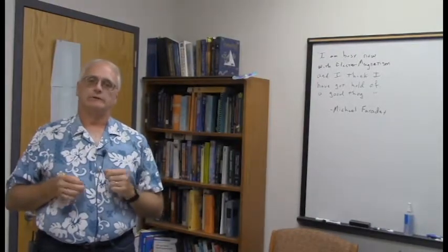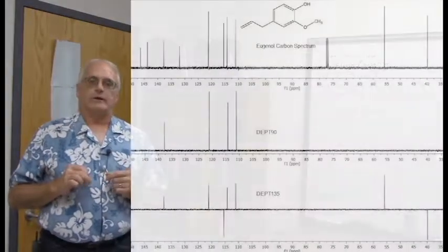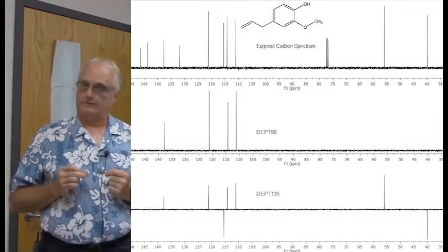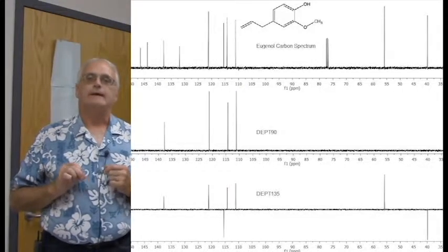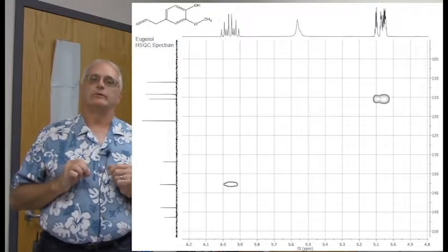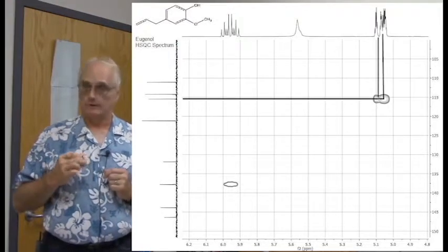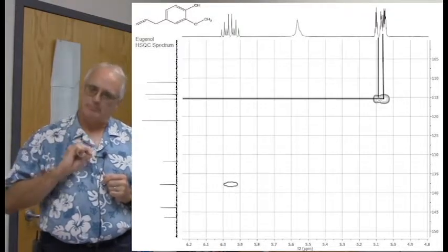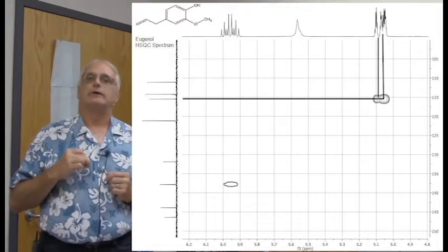And now we use our usual DEPT and HSQC spectra to really start trying to untangle this one. The DEPT spectra show everything we would expect to see, again focusing on the alkene region. There's our dear friend right at 115, the terminal alkene once again, shows up very nicely here in the DEPT spectra. And now the HSQC spectrum shows all the lovely correlations, and focusing on just the alkene region for a moment. There it is again, the carbon at 115 ppm, correlating to the two separate but badly overlapped terminal alkene protons of eugenol.